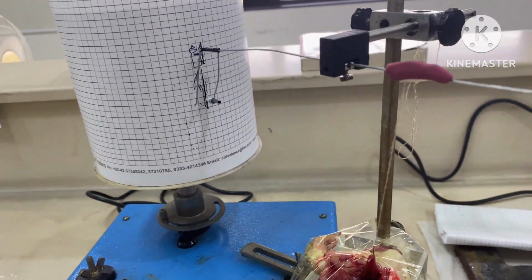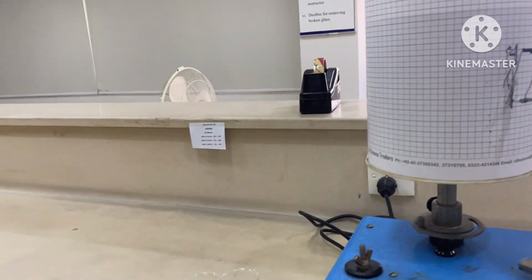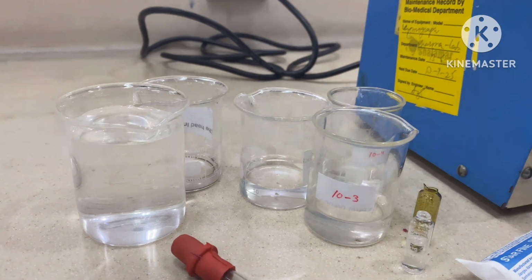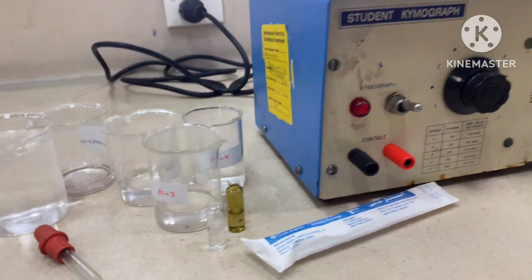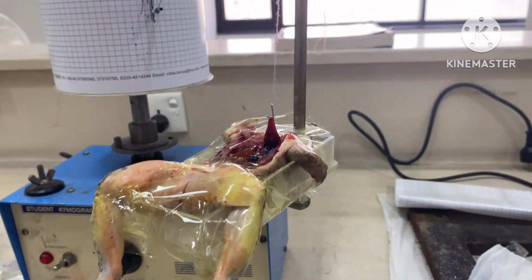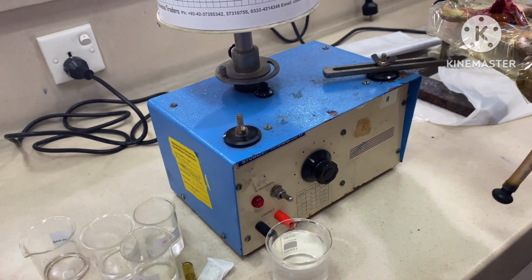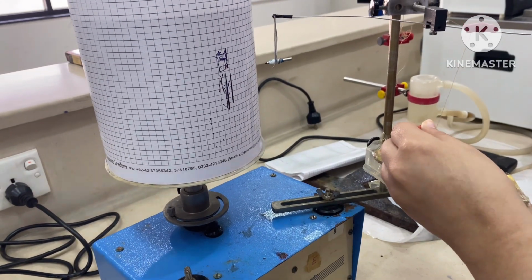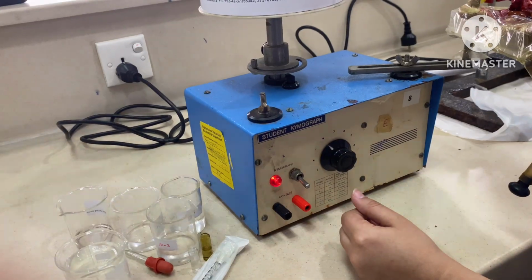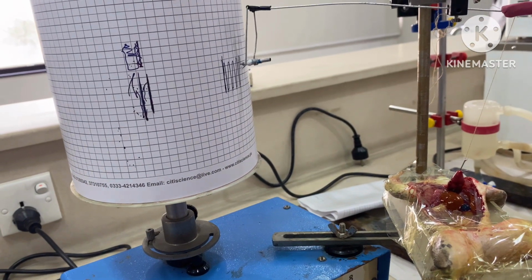For this experiment, the apparatus we need includes a frog, Ringer solution, a kymograph with recording drum, and a complete setup for frog heart perfusion, drugs which include stimulants and depressants, syringes, glass beakers, dropper, and stopwatch. First of all, wash the frog's heart with Ringer solution. Make sure the heart is beating properly and record the baseline of heart rate by counting beats for 1 full minute or for 30 seconds, depending on your time limit.